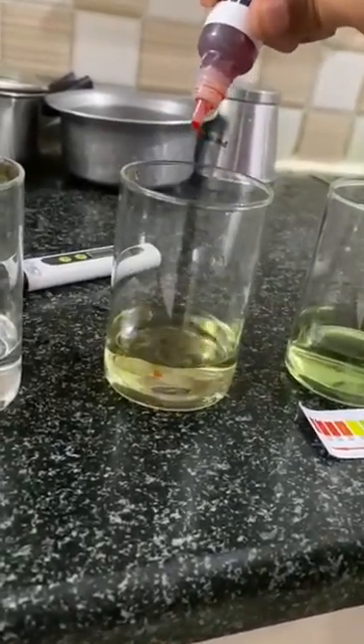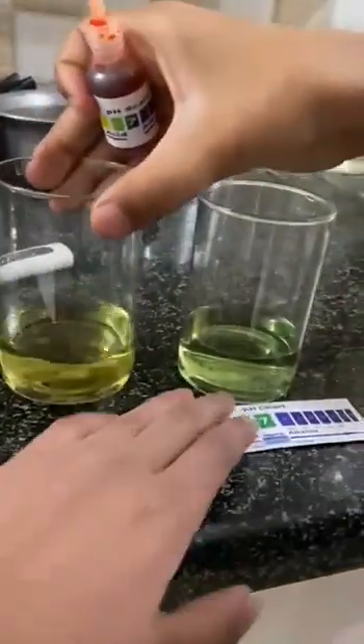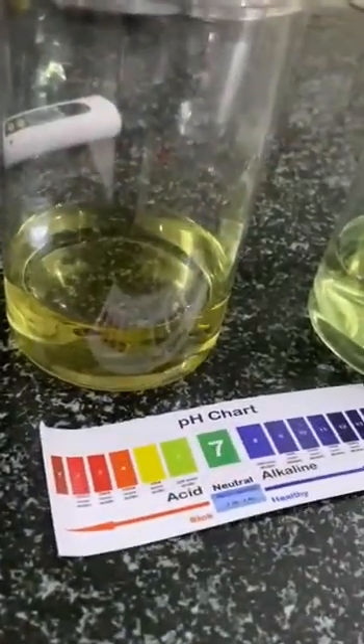Adding 3, 4, 5 and 6 drops for the RO copper sample. So this is more yellowish, and its pH looks like between 5 and 6, which is not good.